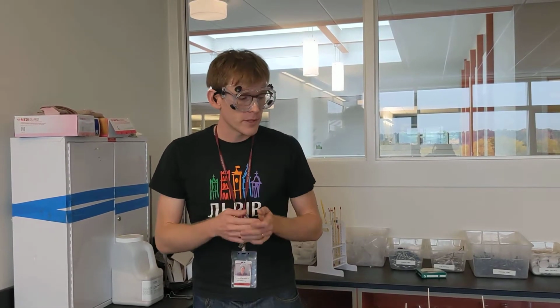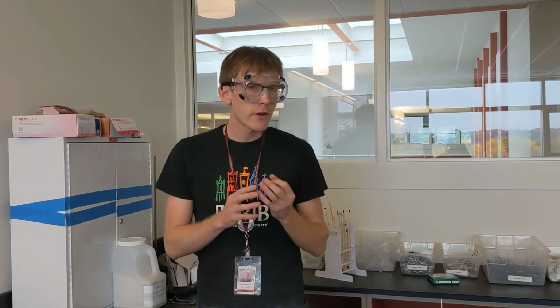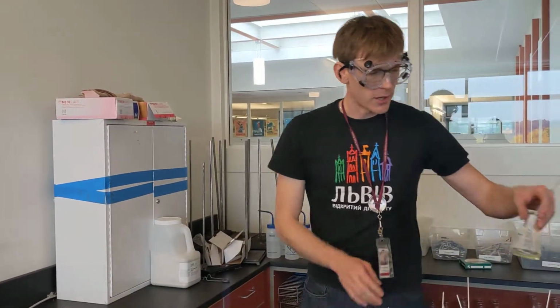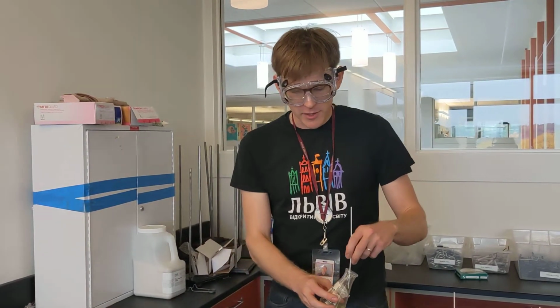And the cobalt glass, it's a filter effectively. It can actually be very helpful because, remember, the sodium gave a very, very intense color, but the cobalt filters it out. Well, what if we have a mixture of, say, potassium and sodium?